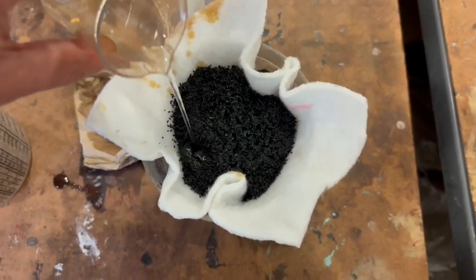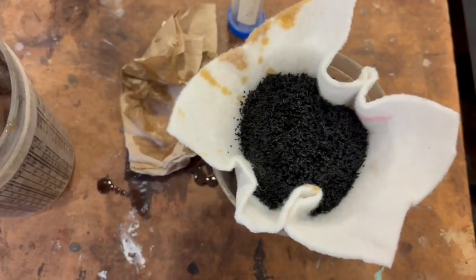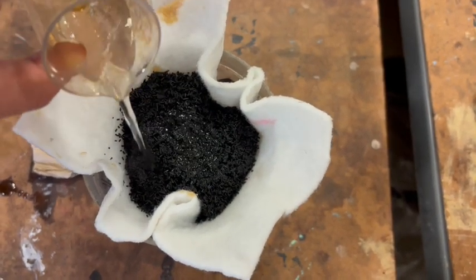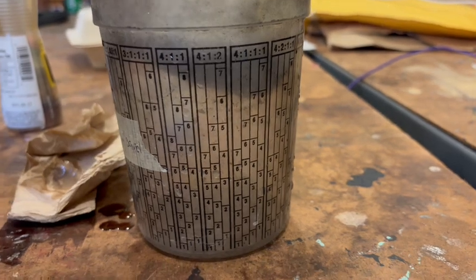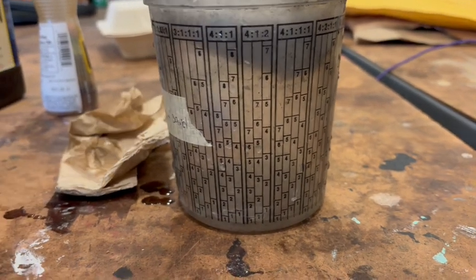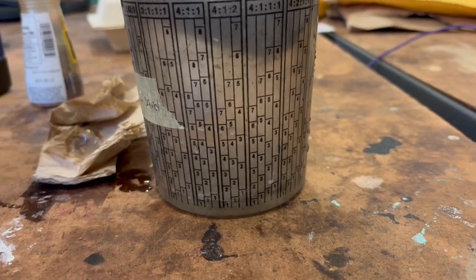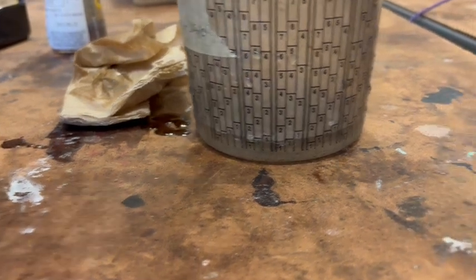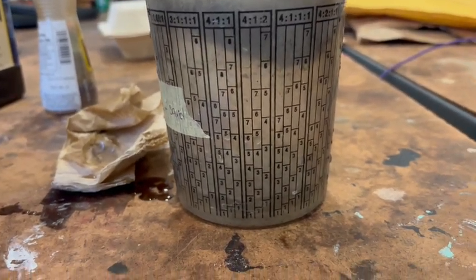As you can see, I'm trying to maximize the interaction of the influent with the surface area of the GAC. I want it to touch every bit of that GAC. Again, I don't want to pour it all through the same spot and get it clogged. So here you can see that nice flow. You see the water is flowing through that GAC and through that micron sheet into the bottom. Now, I will mention the micron sheet is also helping to filter out some of the oil, but the GAC is really doing the heavy lifting here.